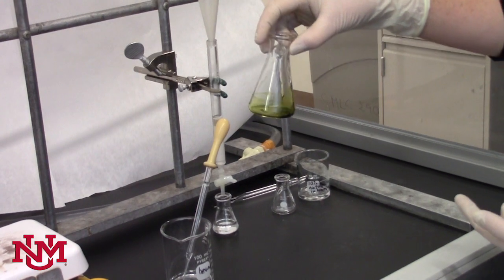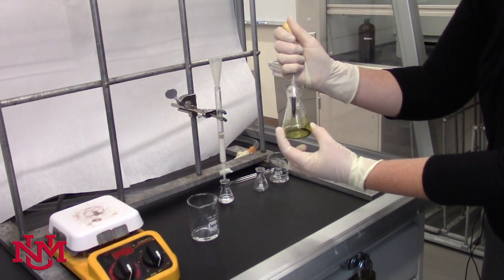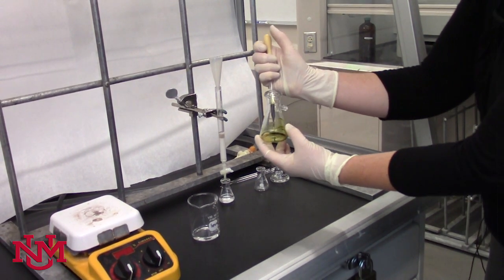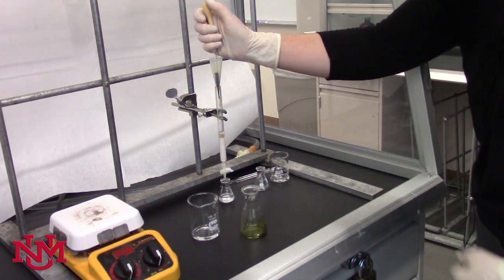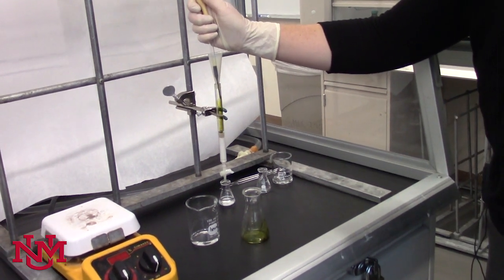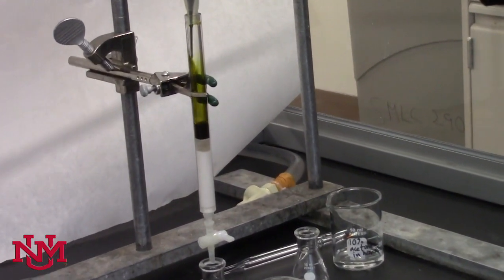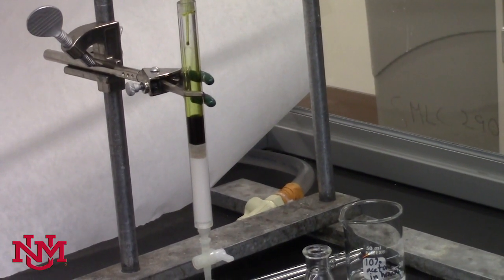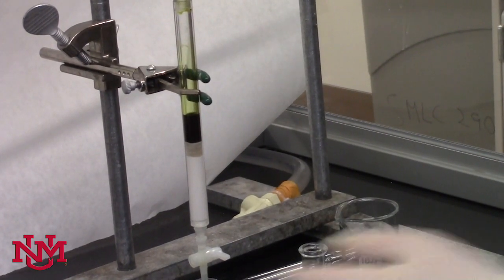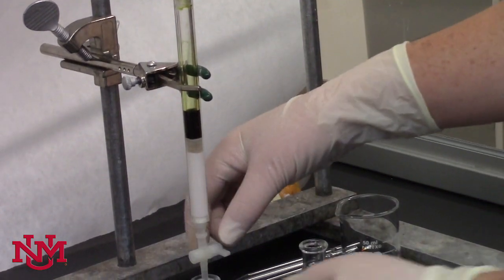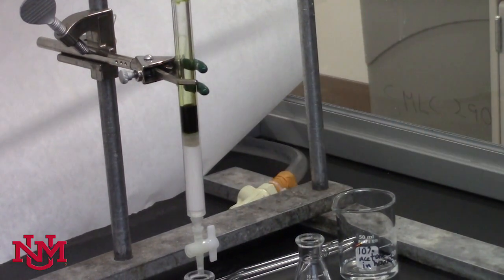Once you have something about like that, take the pipette bulb and pipette and use it to suck up all the green. If you don't get it all the first try, that's okay. Take it over to the sample once you have the solvent level even with the sand, and gently run this down the side of the column so that you apply it all evenly at once in a minimum amount of hexane. That's a pretty concentrated band. We're not going to use this pipette anymore, so we can discard it, but we do need to load the green spinach extract onto the column.